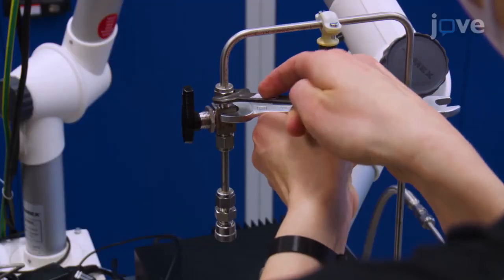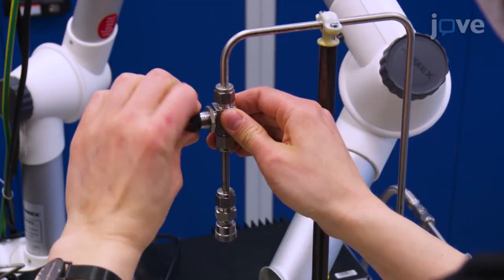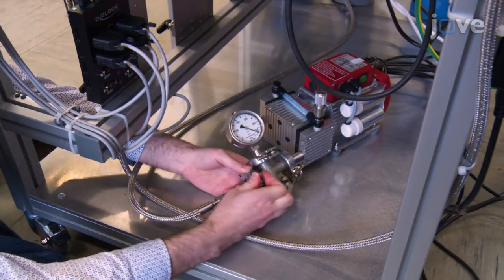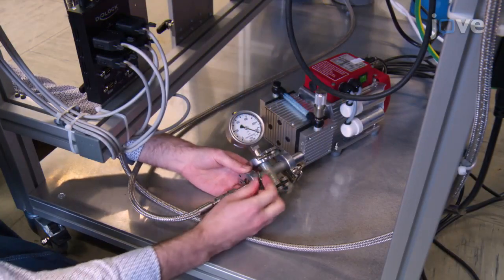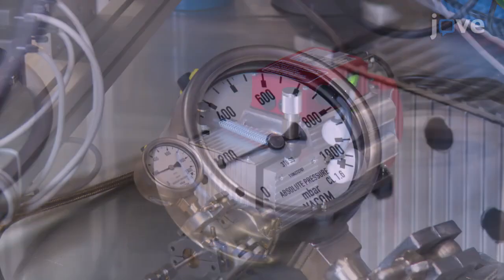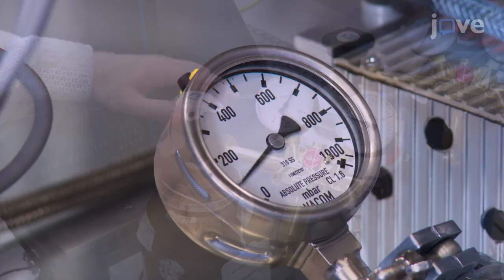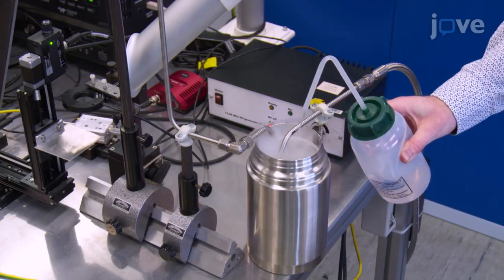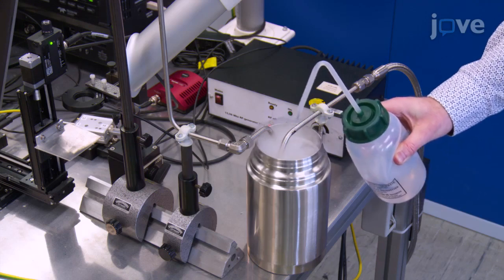Add a valve between the gas supply lines and the jet. Clean the gas supply lines before the surface treatment by pumping and refilling them approximately 3 times. Add a pump to the system and turn it on, then switch off the pump and turn on the gas flow. Add a molecular sieve trap or cold trap.